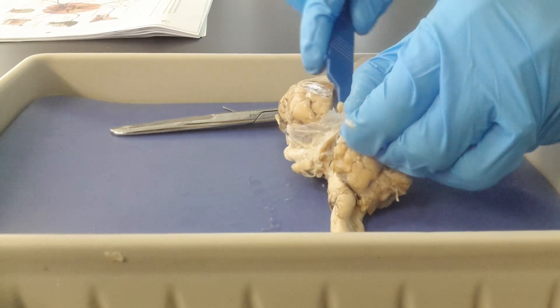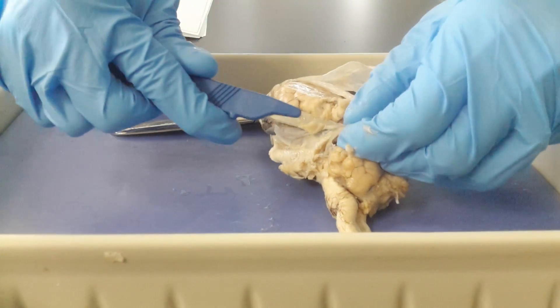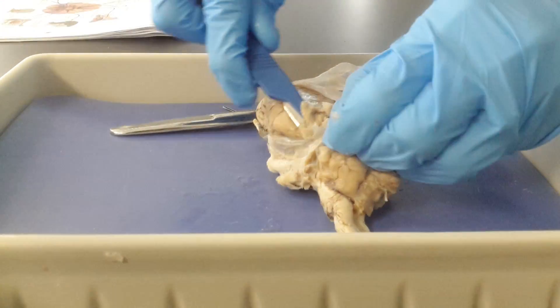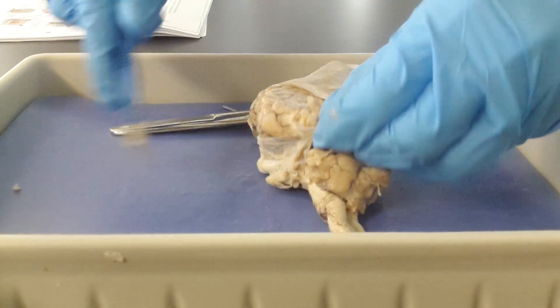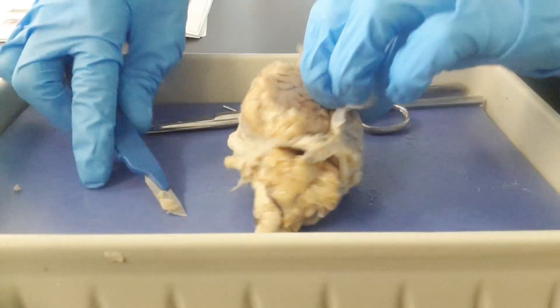These folds are very tough and very strong, which is how they provide so much protection for the brain.